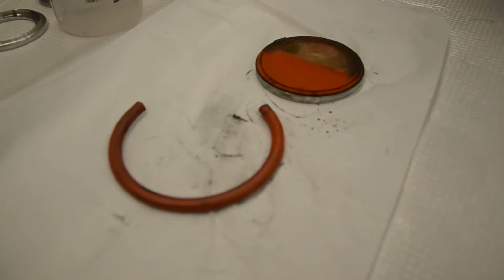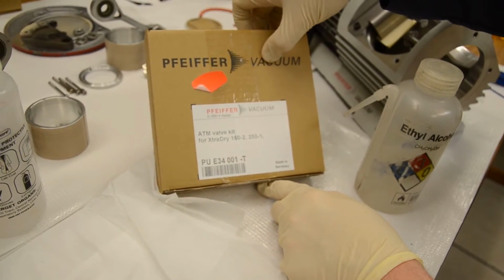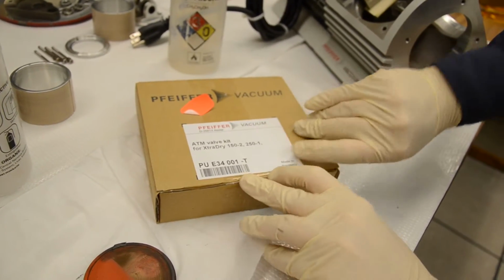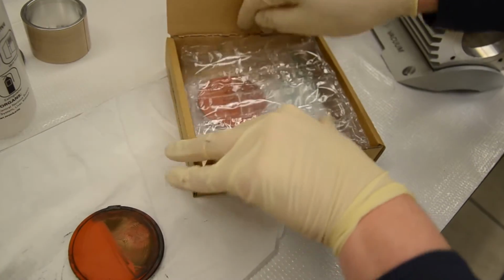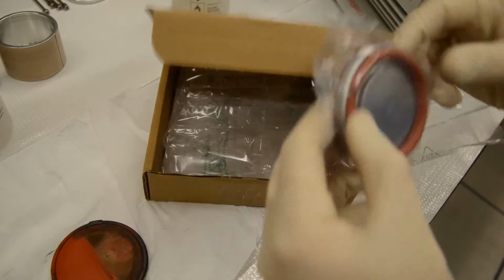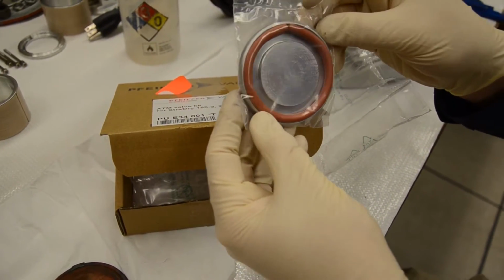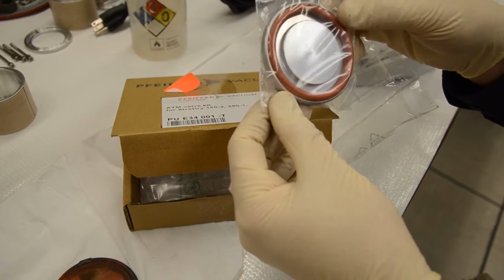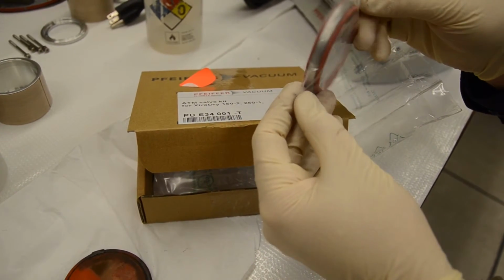Alright, so we have right here the ATM gate valve. This right here is atmospheric, ATM. So as you can see in the package, we have a brand new rubber gate valve with the rubber O-ring. So we'll set this aside and we will add this to our assembly once we're ready to put it back together.